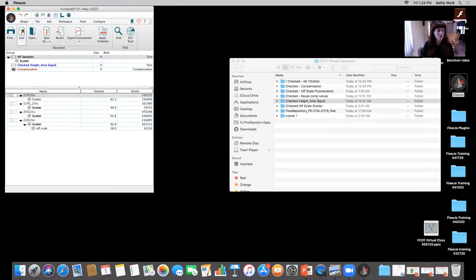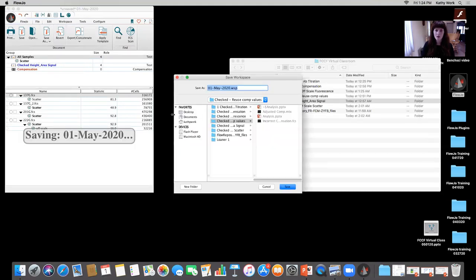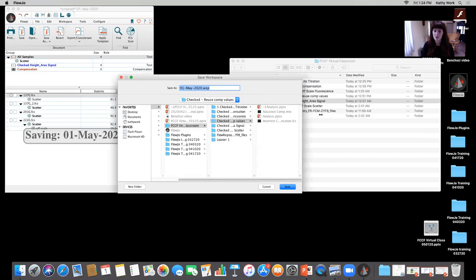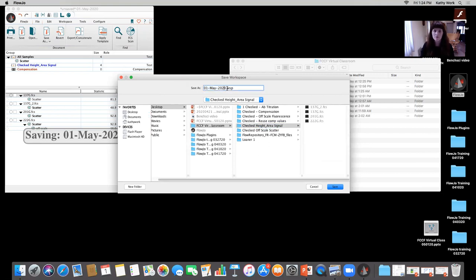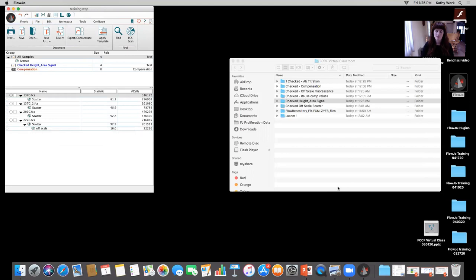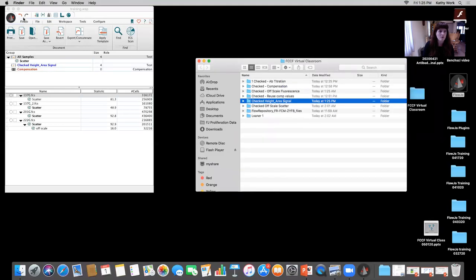I'll save that workspace really quick in case we want to reference it later. For anyone that's not aware, when you go to file, you can either just hit save or save as on the workspace. You can save something as a template if you want to come back and use it as a reference for analysis with other FCS files later. But I'm going to just save it as a workspace, always in the same place where my FCS files are. It's the height area signal, so I'm just going to call that training right there. The reason we save the workspace in the same place as the FCS files is that when you open it up, it knows automatically to bring those FCS files in from the same folder, okay.